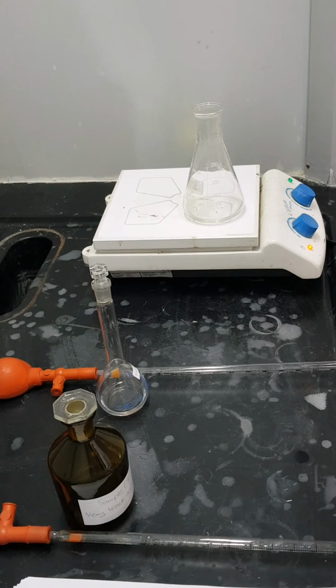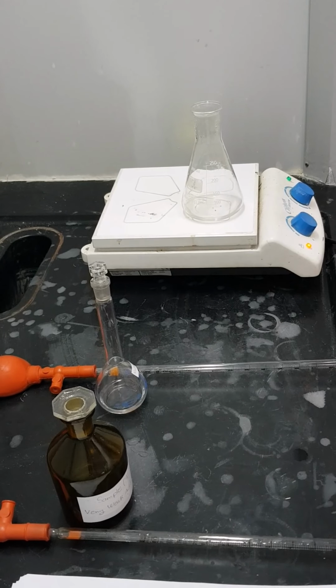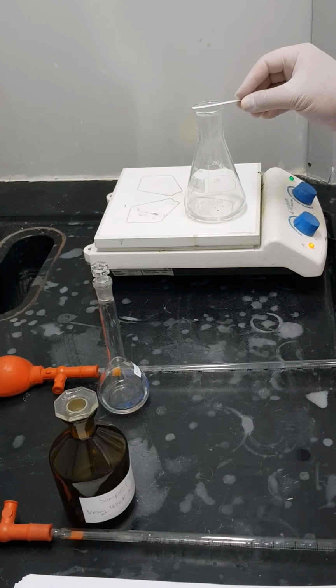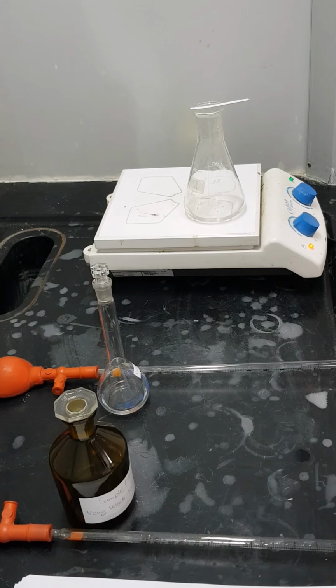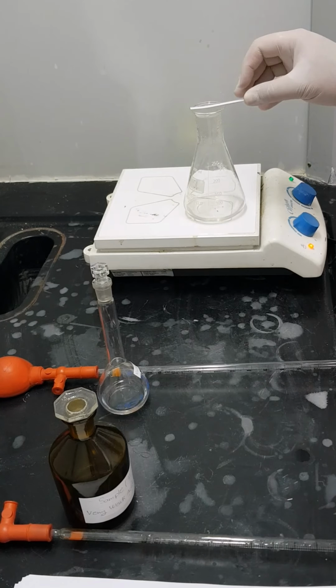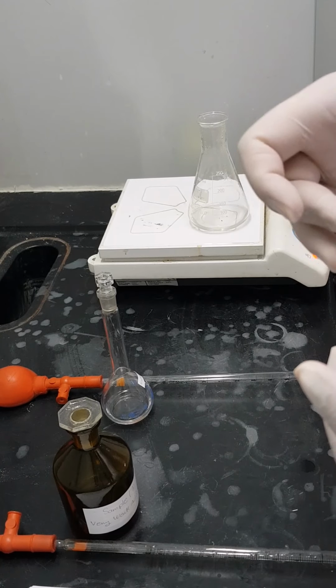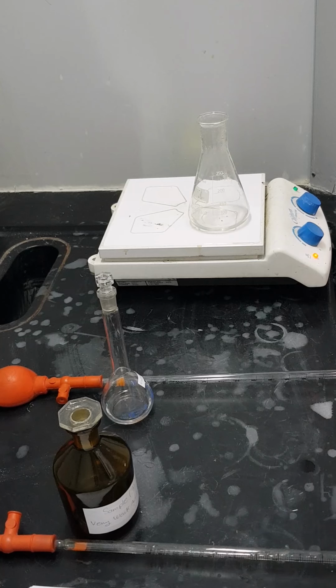Okay, after a while of boiling, now we are going to test if ammonia is still being released from that reaction or not. So simply I'll put another universal indicator strip, and I'll find out if the pH is basic or neutral. Okay, as you can see now, the color scheme is identical to the neutral pH. It means no further ammonia is getting out of that reaction. So I will consider the reaction completed, and now I'm ready for the second step of titration. So let's go and do that.